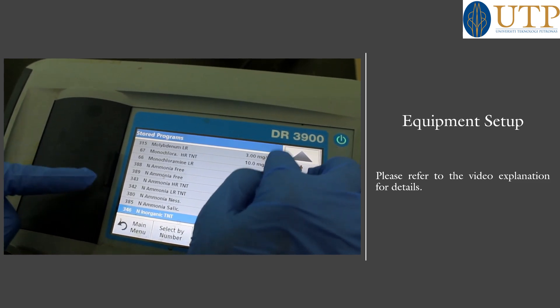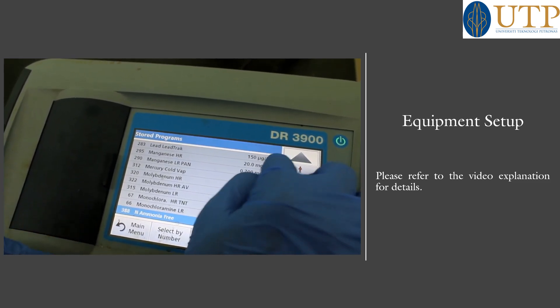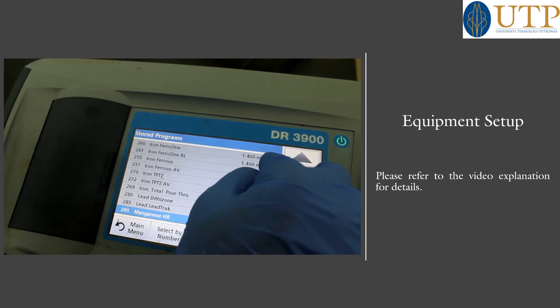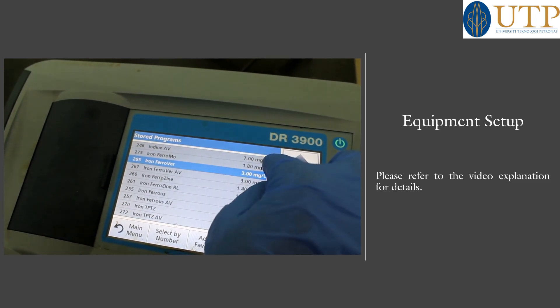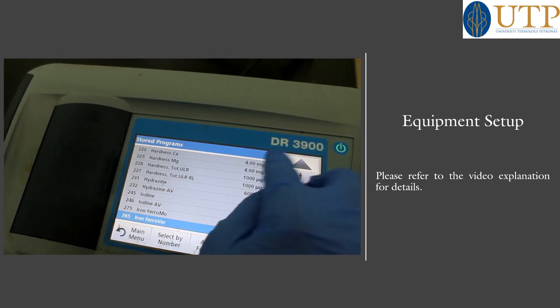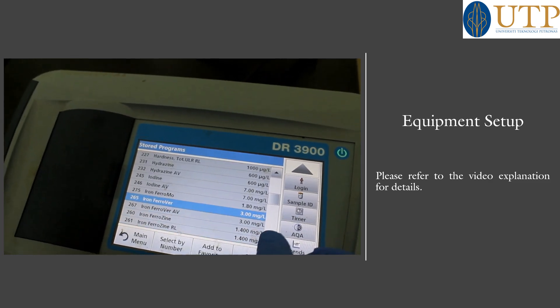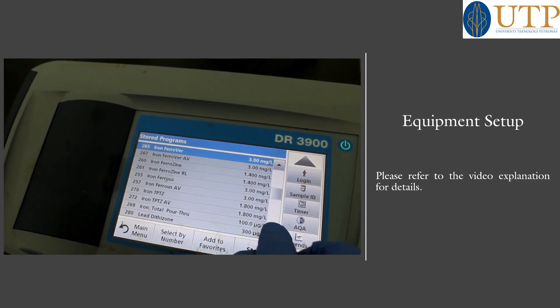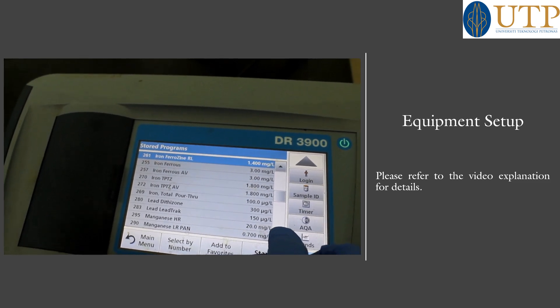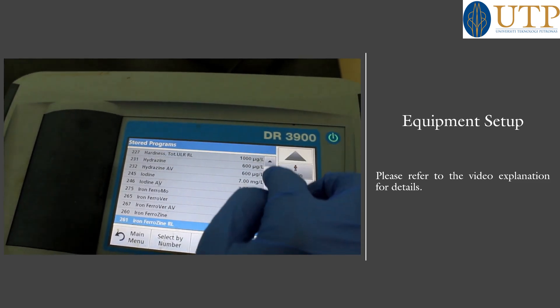You can also see ammonia, molybdenum, lead, iron, and so on. So we are looking for COD.